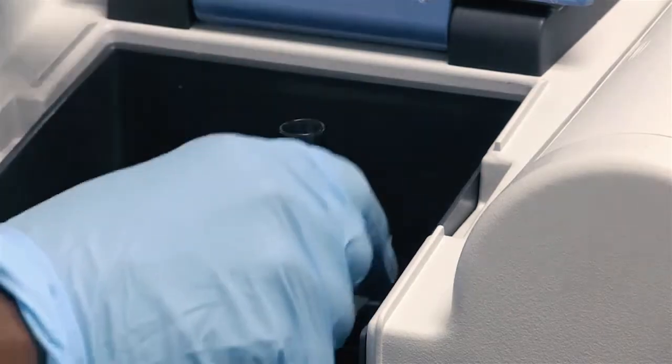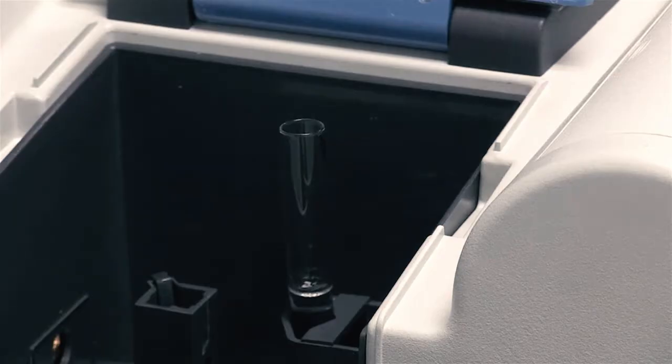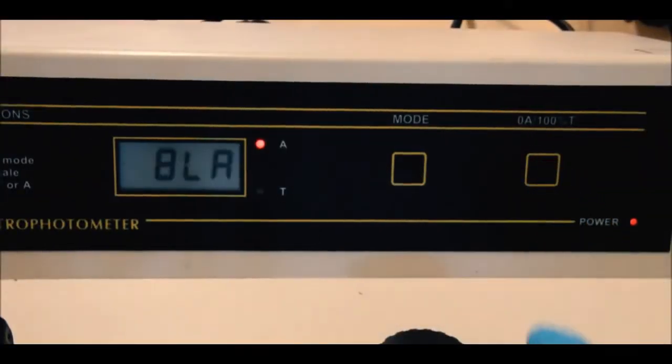The cuvette cover is carefully closed after the cuvette is inserted and the spectrophotometer is blanked, set to the reference of zero absorbance. You need to wait for the meter to set its reference value for the blank tube to zero.